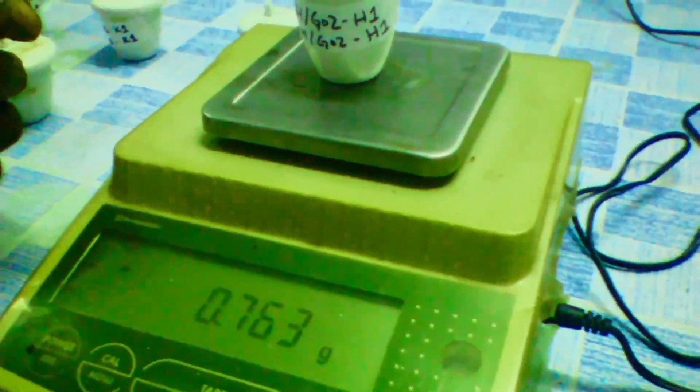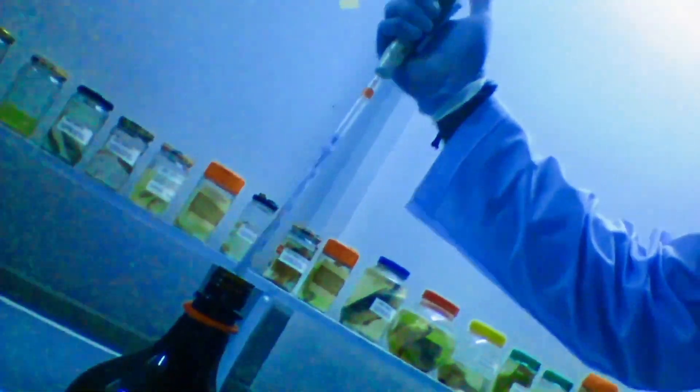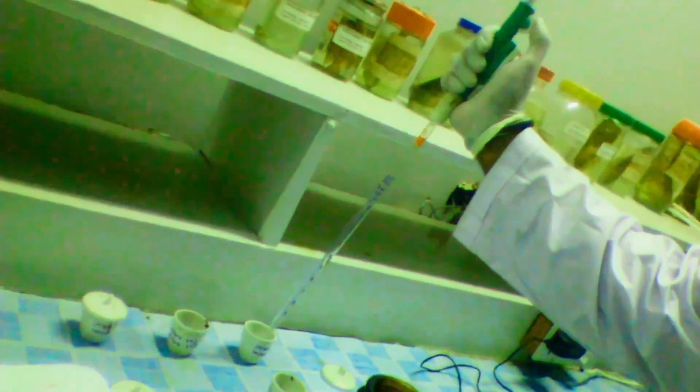As you can see I'm well prepared for this process. Everything is labeled — all the volumetric flasks, all the clay pots, my notebook — everything is properly labeled. Micropipettes and regular pipettes and all the chemicals are placed where they are required so I don't have to reach for them, which saves a lot of time. More time is given for the preparation than during the actual process. So everything is placed in the clay pots — all the organs required are placed into their respective labeled clay pot.